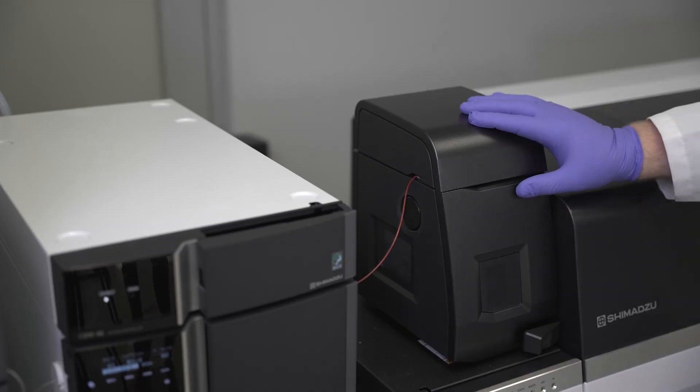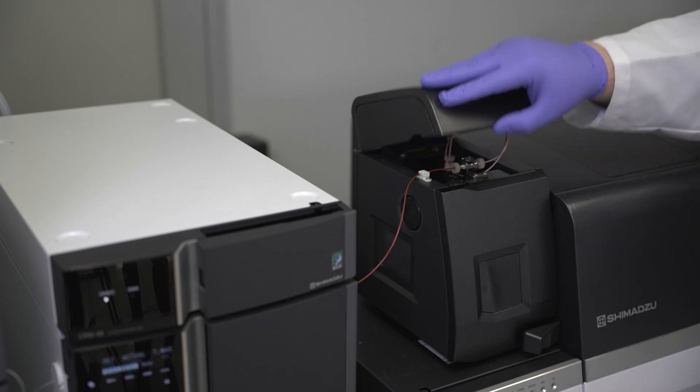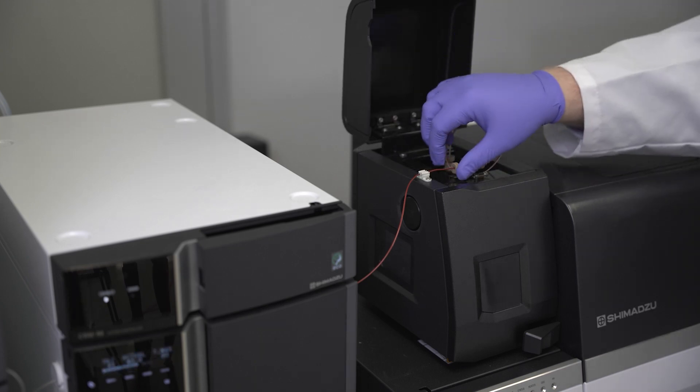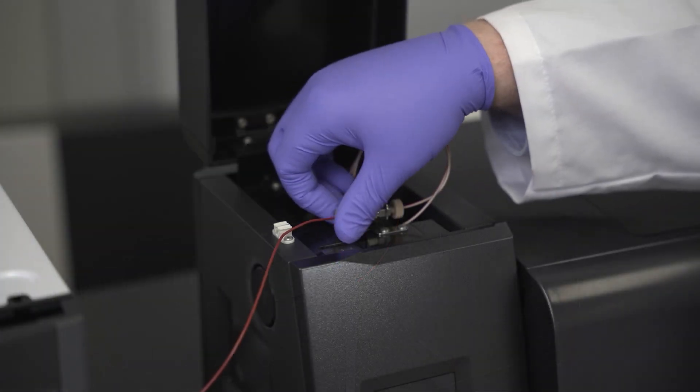After turning off all gas flows and heaters using LabSolutions software, allow the unit to cool to room temperature, then remove the LC connection tubing.